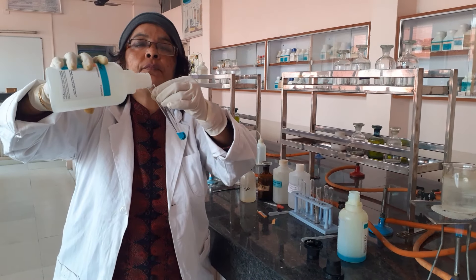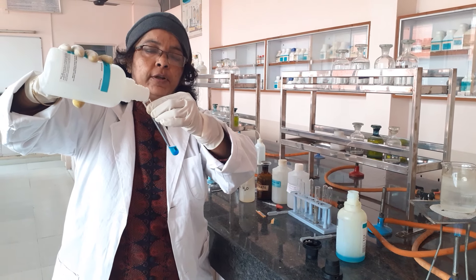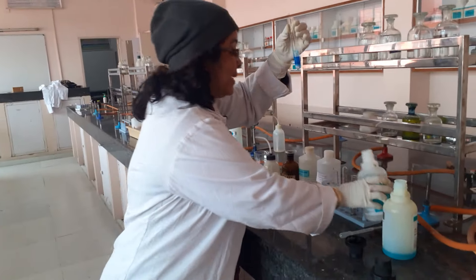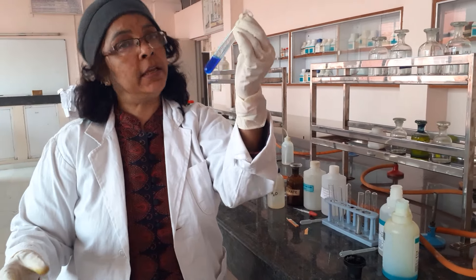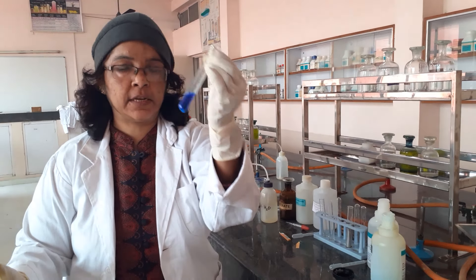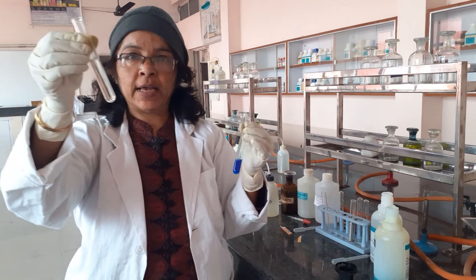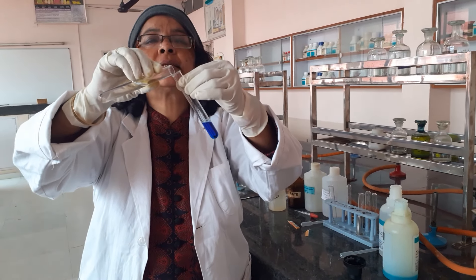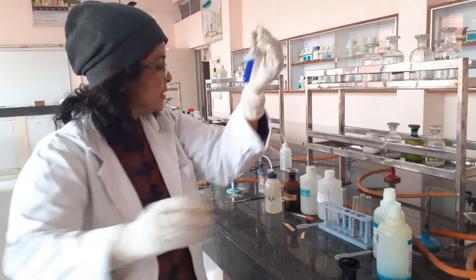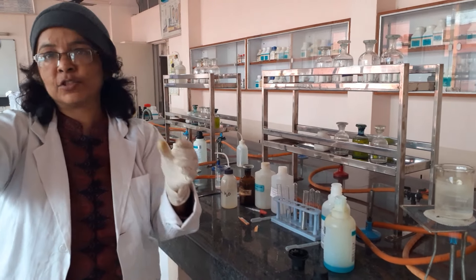Please observe the color change carefully. You can see the color is changing to deep blue. So this is my Fehling's reagent, which is Fehling's A plus B in equal amounts. This reagent has copper in the Cu²⁺ state. Now add the organic sample directly into the Fehling's solution. You can see no change yet, because the temperature is low — we are in winter — so the test is not showing any result.